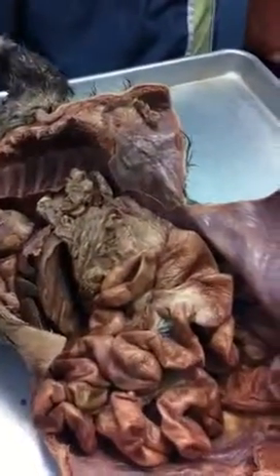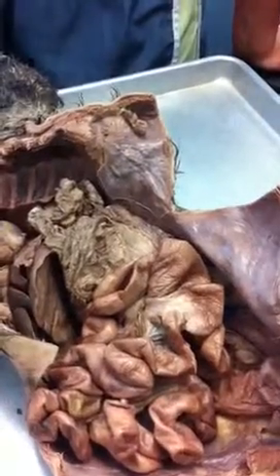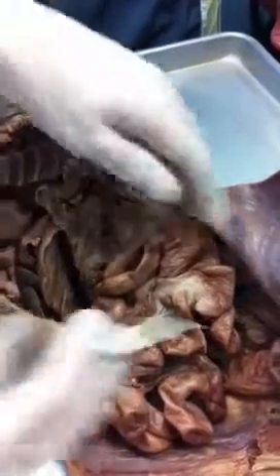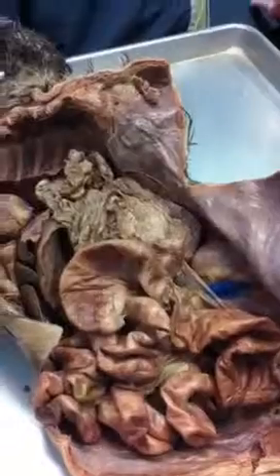Now, where is it located in humans typically? Right, the right lower side. So if I would push into somebody and they had appendicitis, it would feel really good. If I let out, they'll be like, ow, ow, ow. Okay? That's an indicator. All right, so we're in the cecum of the colon. And then in cats, the large intestine or the colon is not divided, but it is in humans.